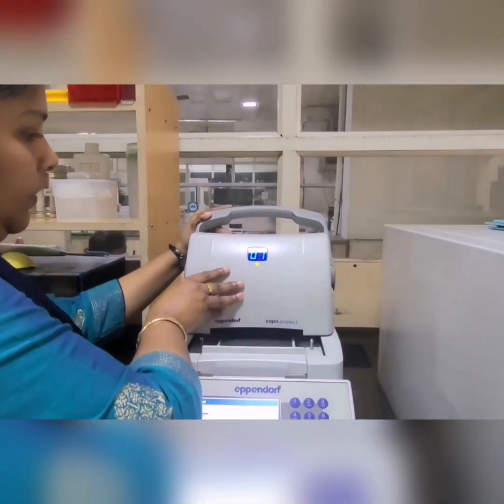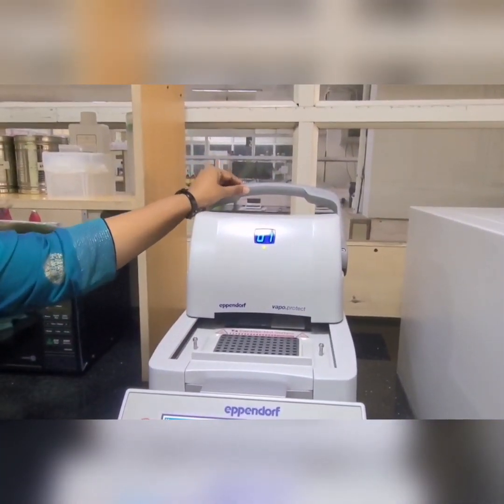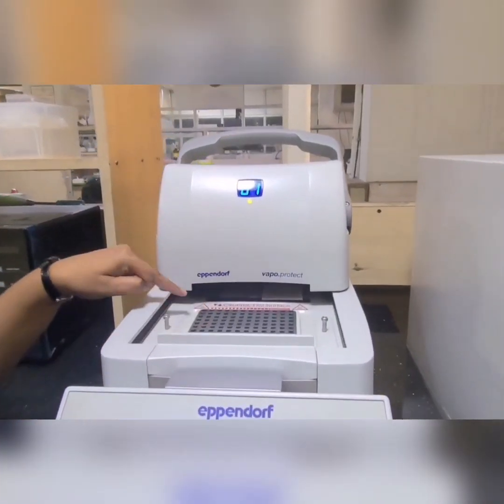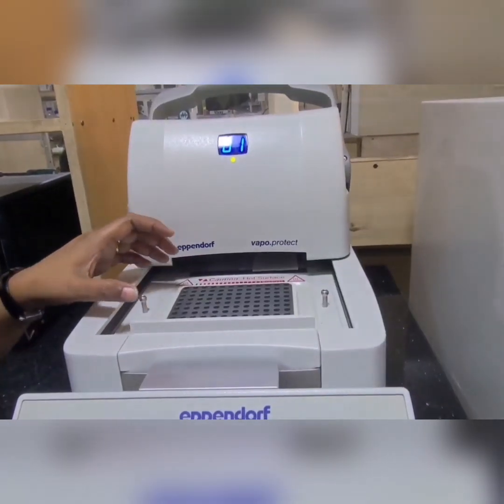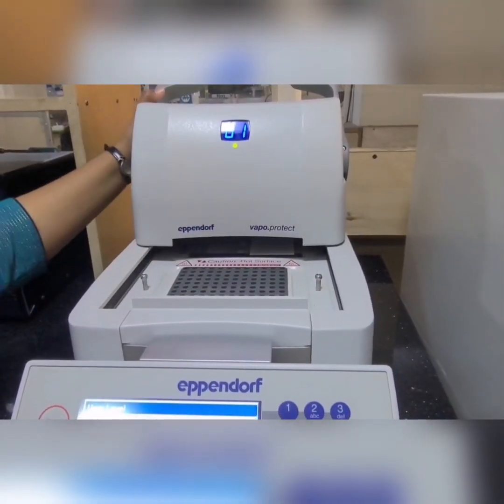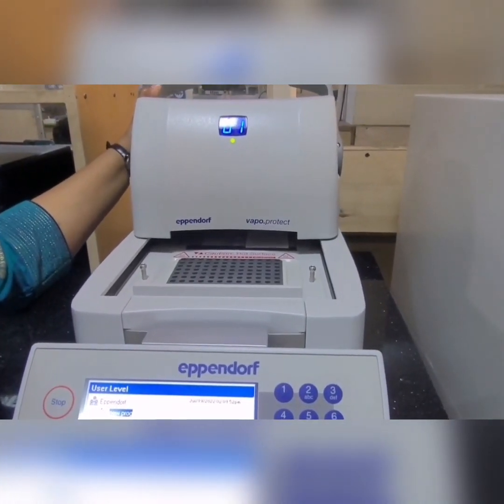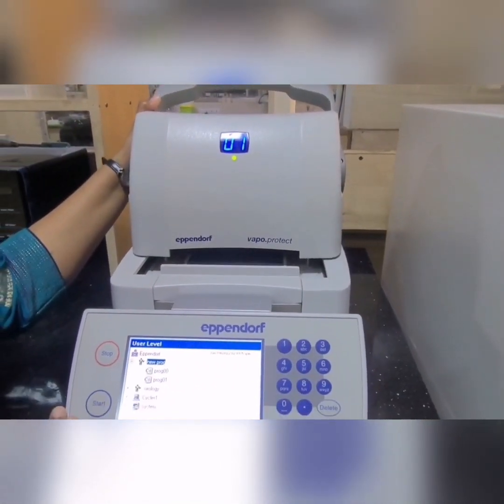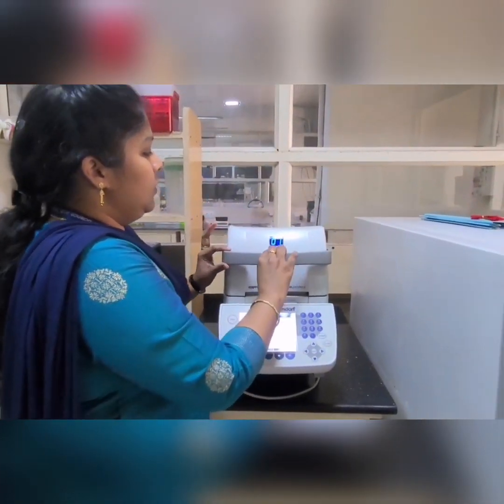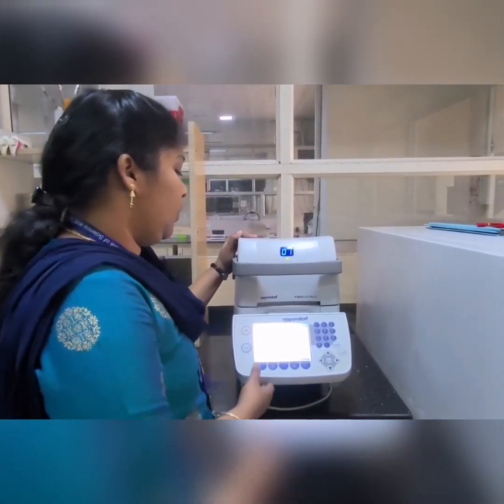To open the machine, you raise the handle and then push it back. Here you can see the 96-well heating block. At a time you can carry out 96 PCR reactions. For closing, you just pull it and then lock it like this — once you do this the machine is locked.